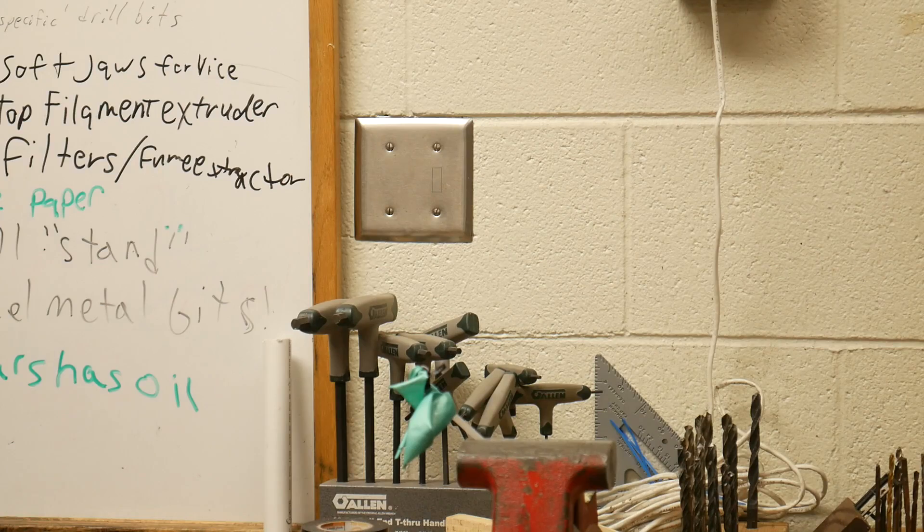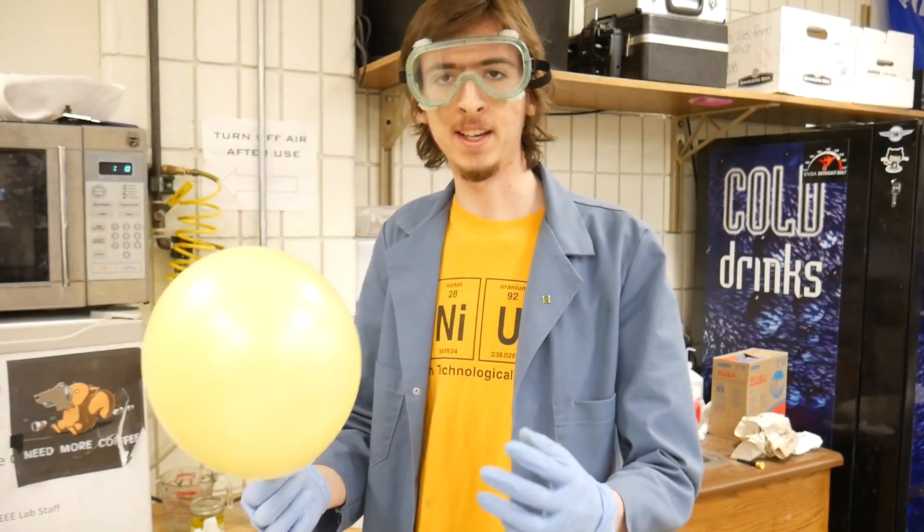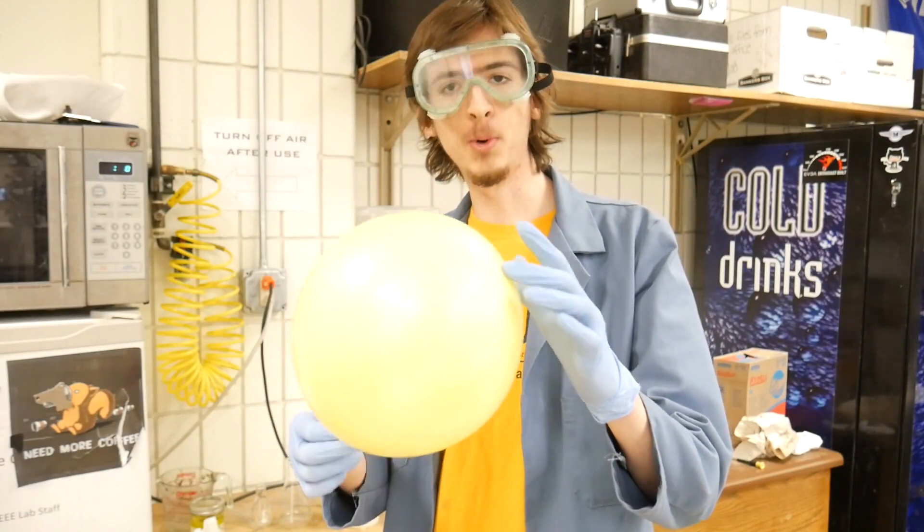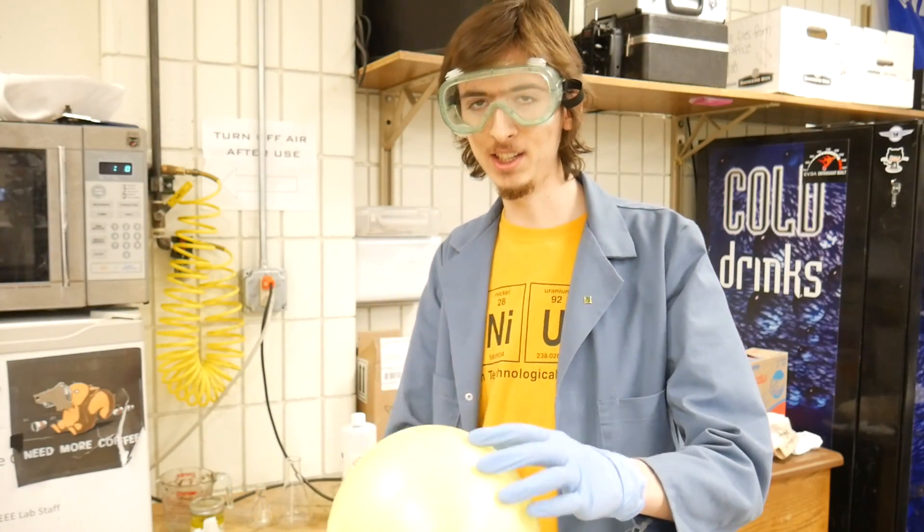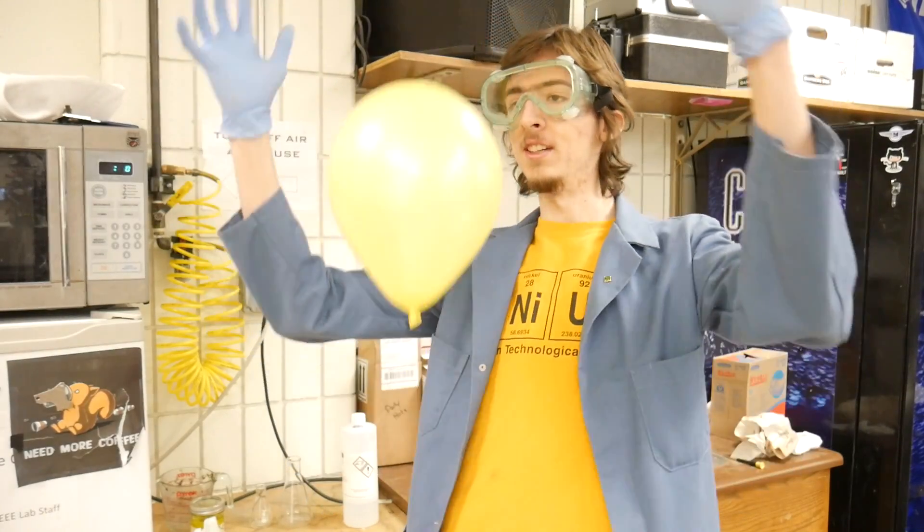Aha there we go. I can't believe I've forgotten to mention up until this point but hydrogen as you may have guessed is lighter than air, a lot like helium. So if I let it go, it ascends.